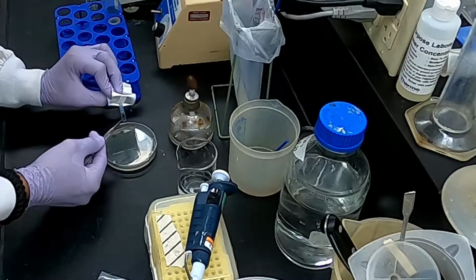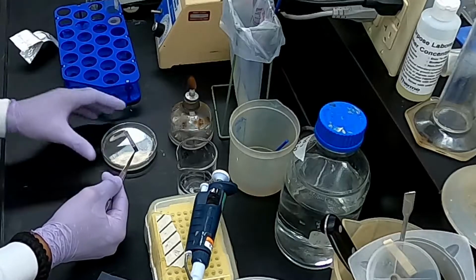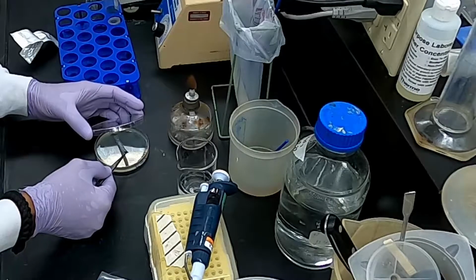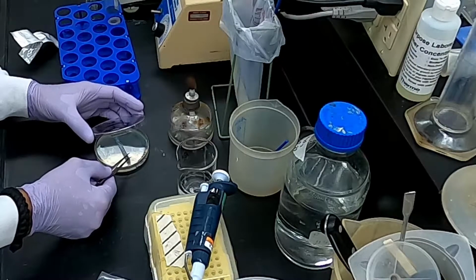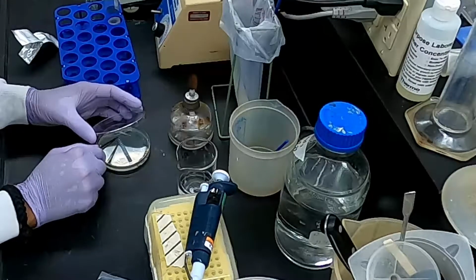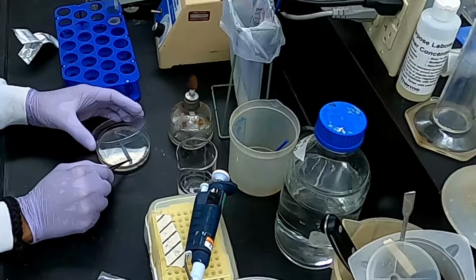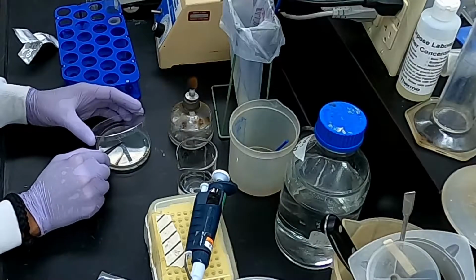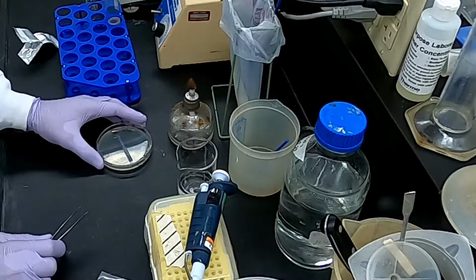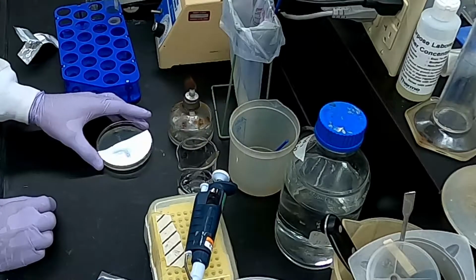And then remove the strip from the packaging, and you just want to lay it down about center of the plate, like that. Be very careful that you don't form any air bubbles because you want the strip to lay flat against the plate. So if it's sticking up in any places, you just want to very carefully pat it down with a tweezer so that it lays flat. And those can just go back into the ethanol afterwards.